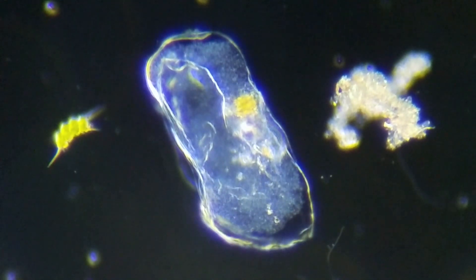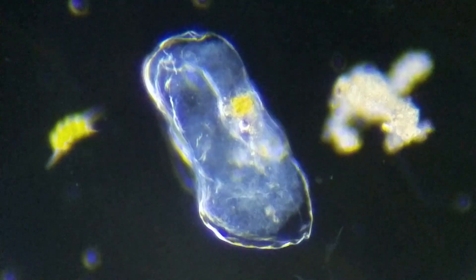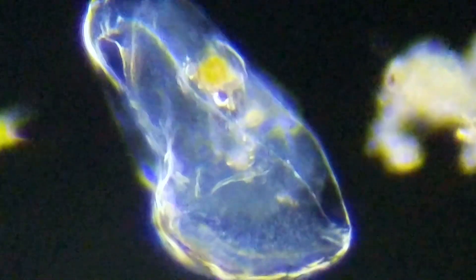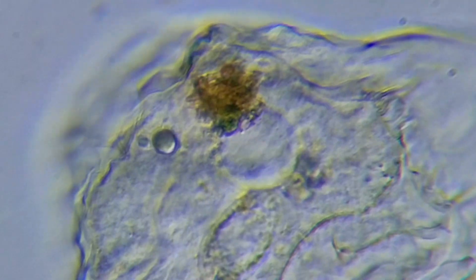To the left here is a kind of a yellowish green diatom. We'll look at this one a little bit and you'll see the cytoplasm inside the cell, and the granules and the organelles and various things inside here are moving. They move by extending and retracting what's called pseudopods, and amoebas do not form a single cell taxonomic group — instead they are found in every major lineage of eukaryotic organisms.